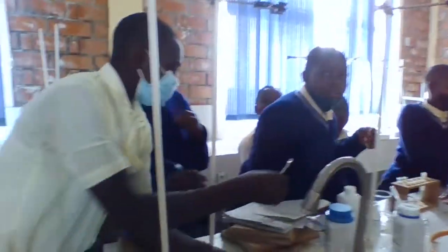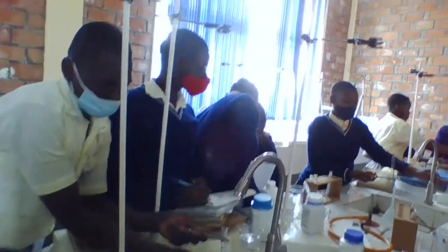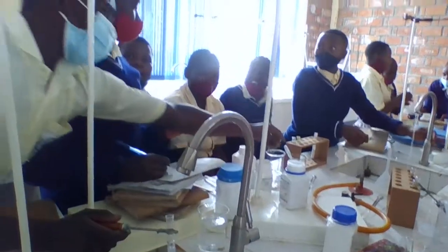Was it okay, you write it also. It is endothermic. Endothermic reaction.